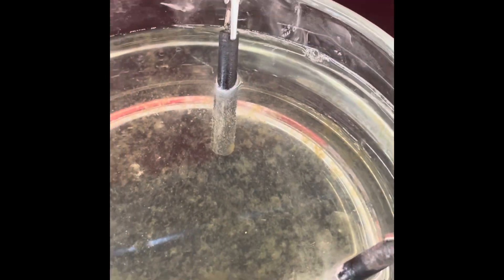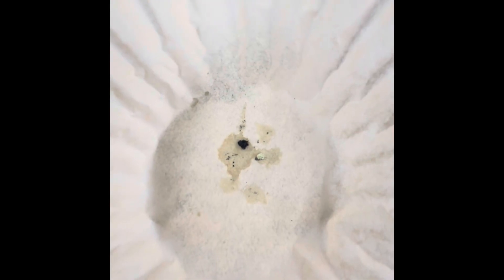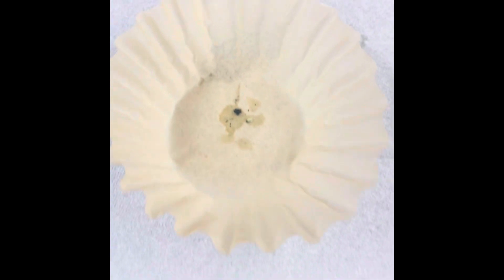I'm completely at a loss here. As I leave the zinc metal out, you can actually see it very slowly start to oxidize in the air. This is kind of odd — the powder must be really fine. I've never had this happen before.